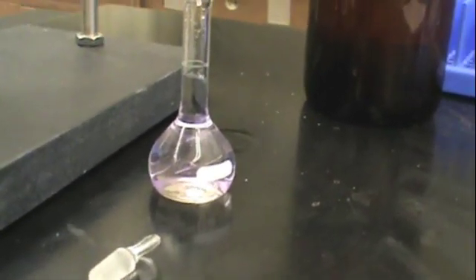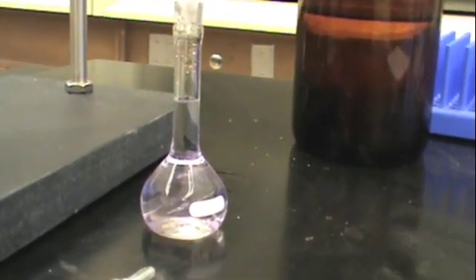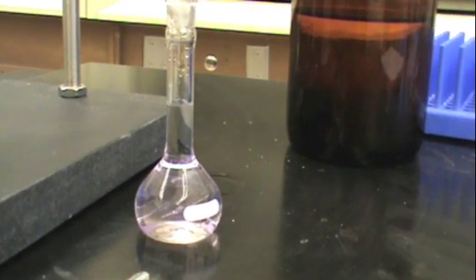You'll want the bottom of the meniscus to be touching the line for your solution to be at the proper volume as shown here.